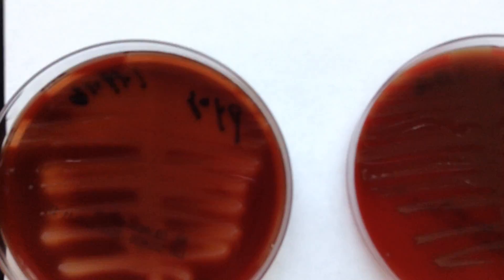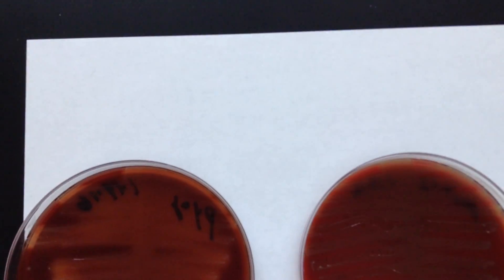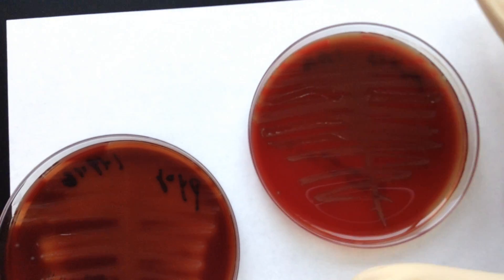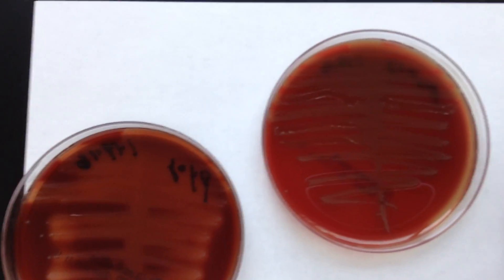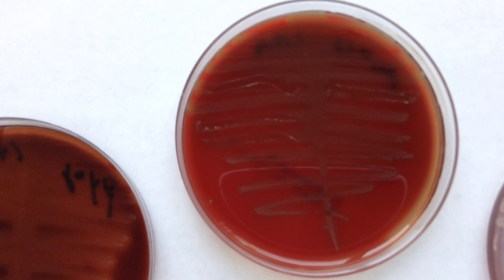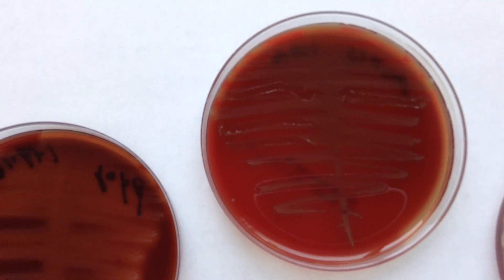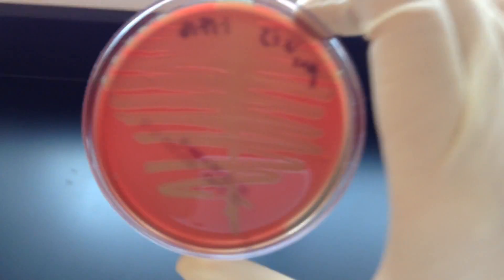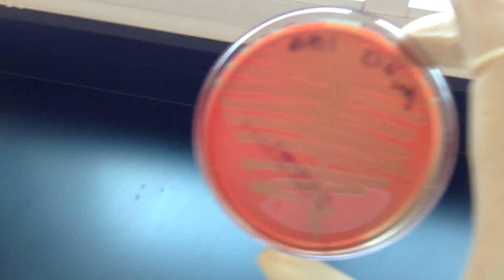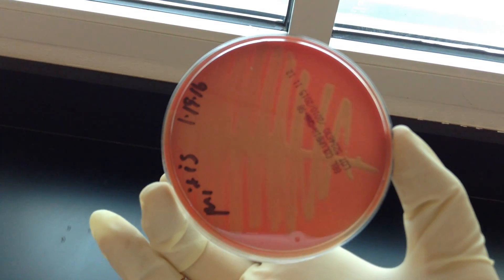The next type of hemolysis is a partial hemolysis, and we call organisms that can do this alpha hemolyzers, or the reaction alpha hemolysis. Alpha has a kind of metallic olive green appearance on the top of the medium. Holding this up, we can kind of see that greenish color that's there.